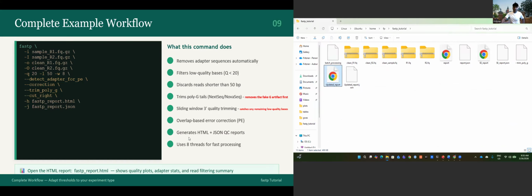Okay, so we generated that one. What does this command do? It removes the adapter sequence automatically, filters low quality bases that are less than Q20, and discards reads shorter than 50 base pairs. The trim poly G removes the fake G artifact first, the cut right catches any remaining low quality bases, and it also looks for overlap base error correction, and generates HTML and JSON reports. Yeah, this is what we use.